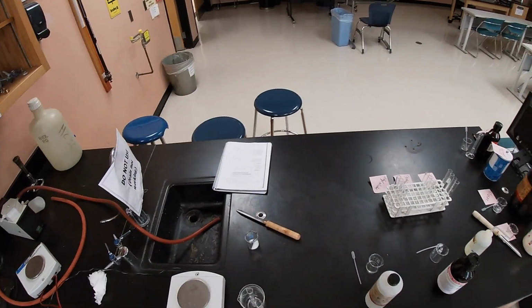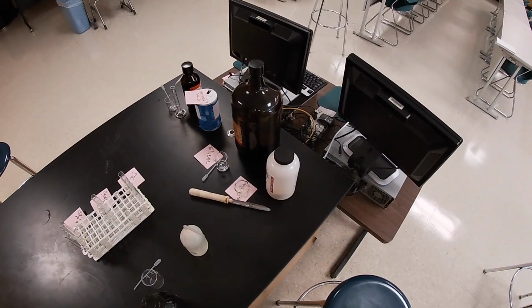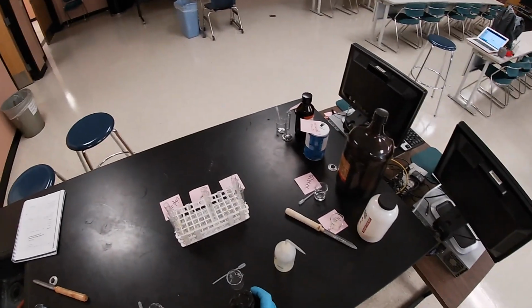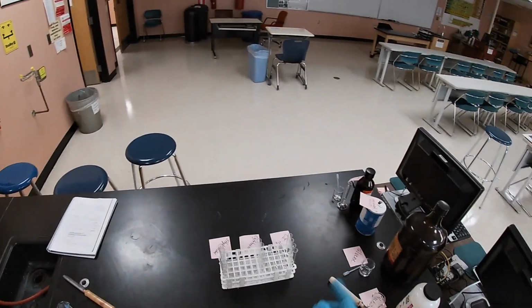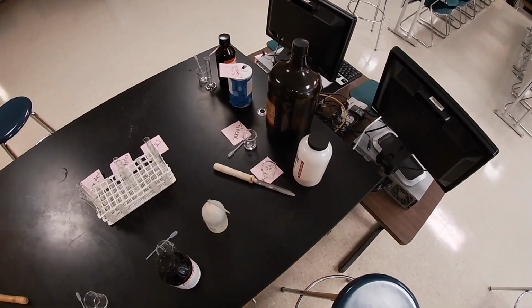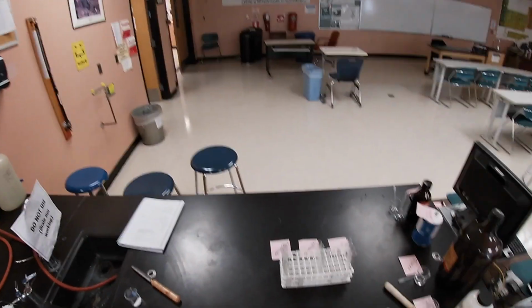All right, so trying to connect here. Based on what we saw on our solubilities, cyclohexane was one of the solvents that did not dissolve the white solid that we have. So what I'm going to try to do here is, hopefully you all can see, I'm going to fix it.